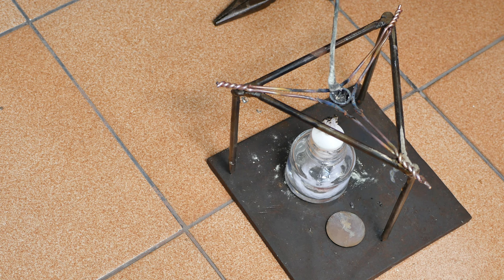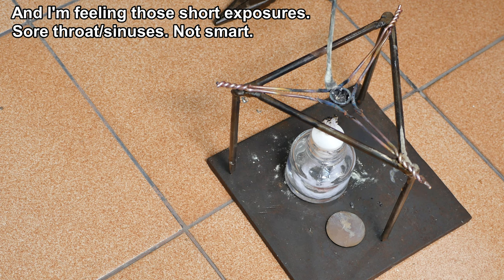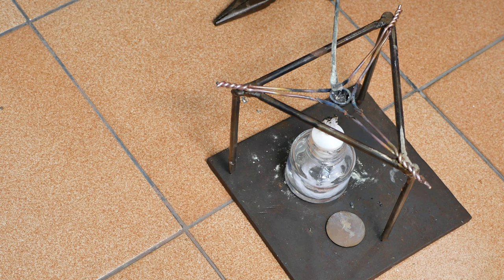And then every once in a while I would take the respirator off long enough to smell and see if I could still smell the sulfur burning. And once I couldn't smell it anymore, I determined it was probably done. I let it go for another minute or so just to make sure. And then I blew out the flame and let it start cooling on its own. So that's where we are right now.